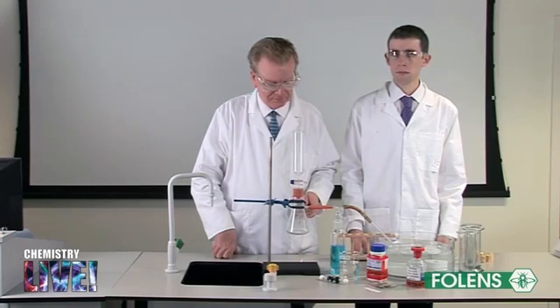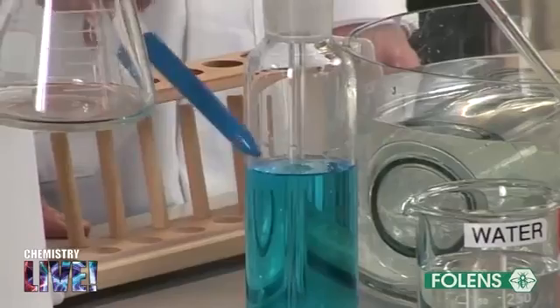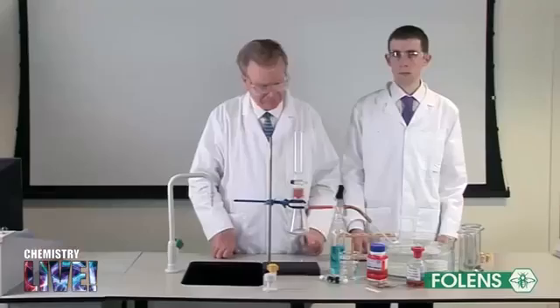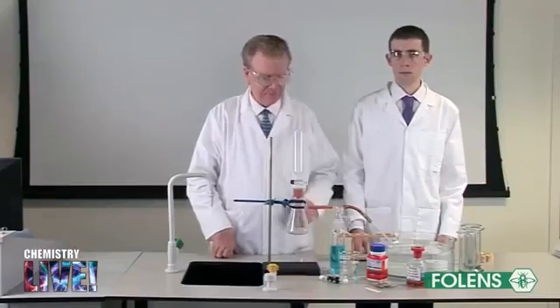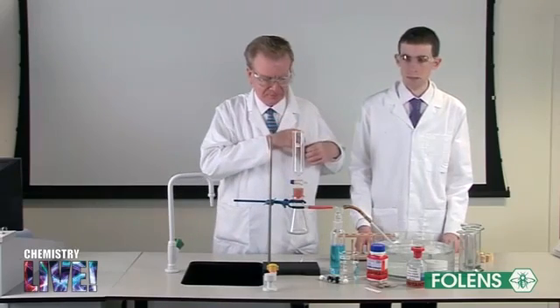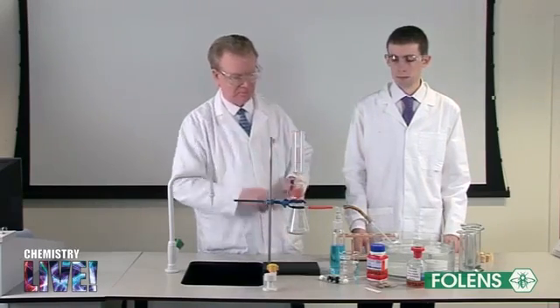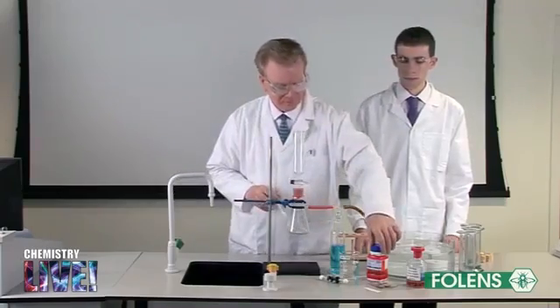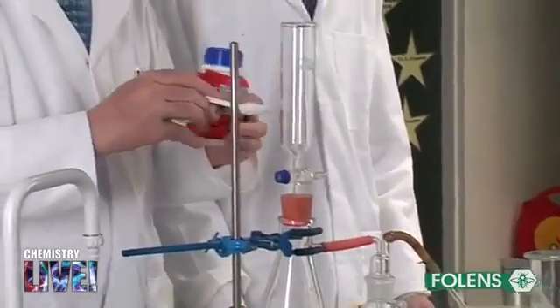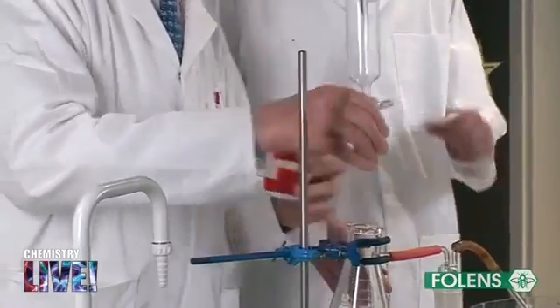These gases are removed by bubbling the gas through acidified copper sulfate. Set up the apparatus as shown. Do not touch the calcium carbide with your fingers, as moisture from your hands could start the reaction. Use the spatula when transferring the calcium carbide to the flask.